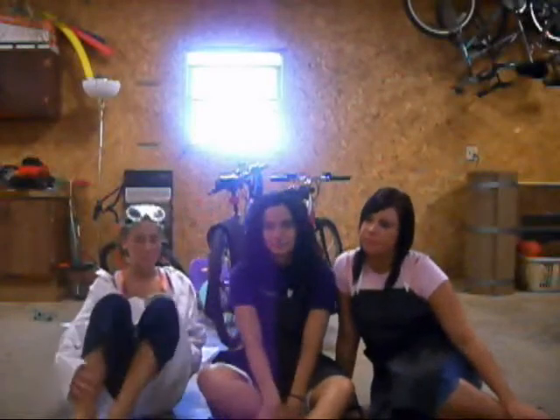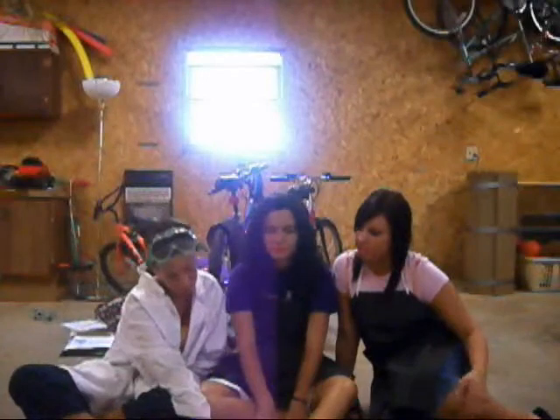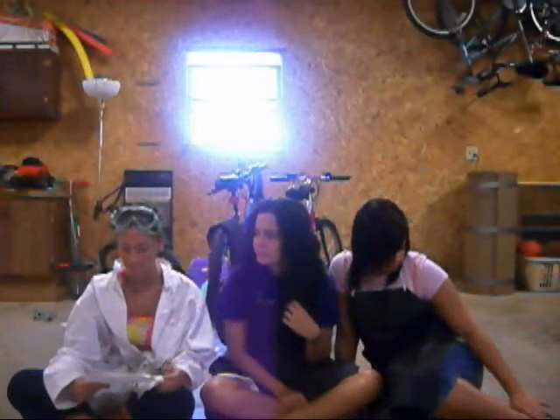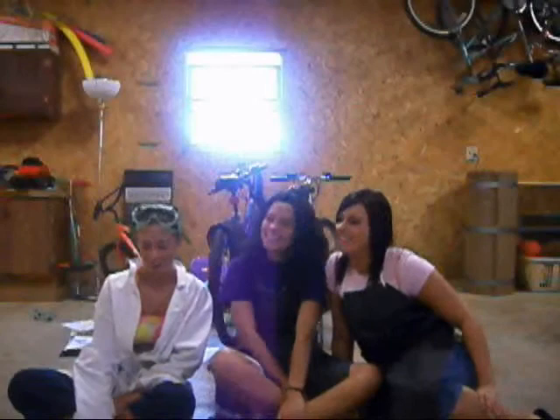And for lab number 3, we definitely made a mistake by leaving our chemicals unattended. One should always watch the experiments. They must be personally monitored at all times and never leave chemicals unattended. So we shouldn't have gone and asked Mr. Sully a question without making sure that some hungry person wouldn't come and try to eat our Chinese cravings, our chemical fungus things.